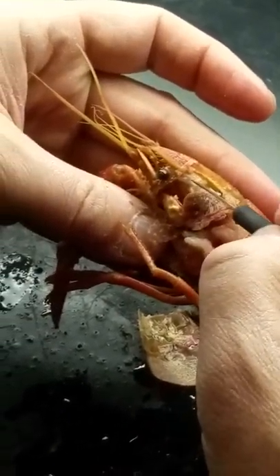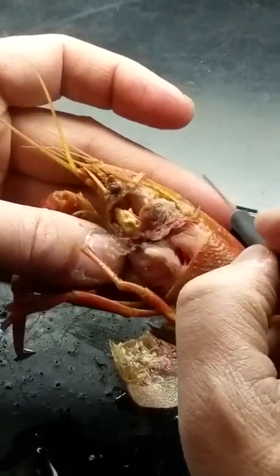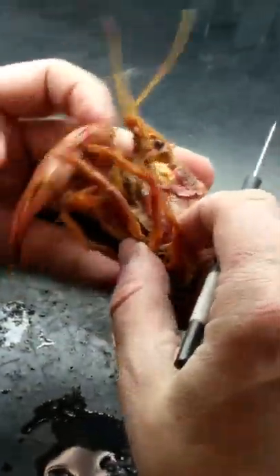This right up here is the stomach. We have a cardiac portion up here and a pyloric portion back here. I'll discuss the internal structures when we get to them — that's why I need to get that off to gain access.